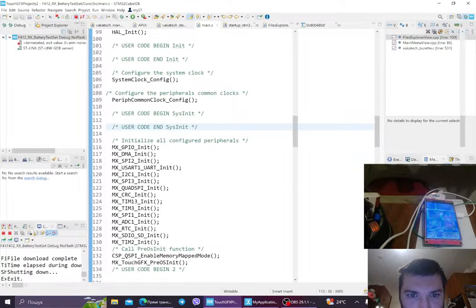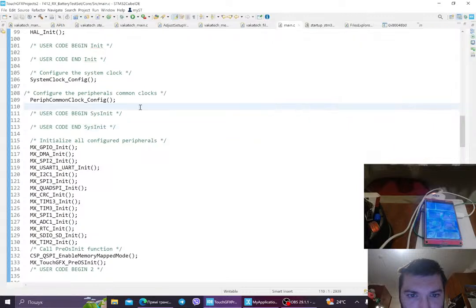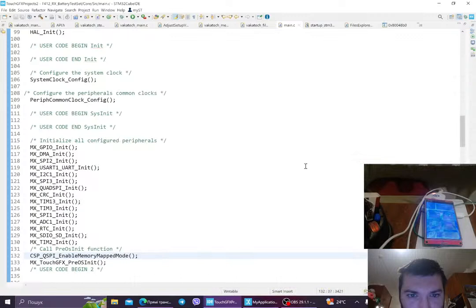So I'm back. I would like to introduce myself. My name is Eva. I am a chemist, but I work a lot as a programmer, and I'm trying to make my own device that people are gonna use in a library, in a laboratory. And well, you see, right? It is controlled by an STM32 board. This board we made ourselves, and yeah, let's go to it.